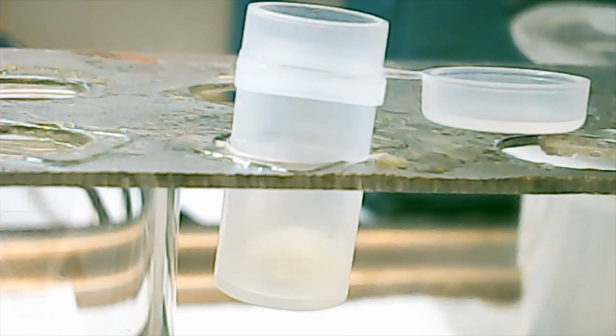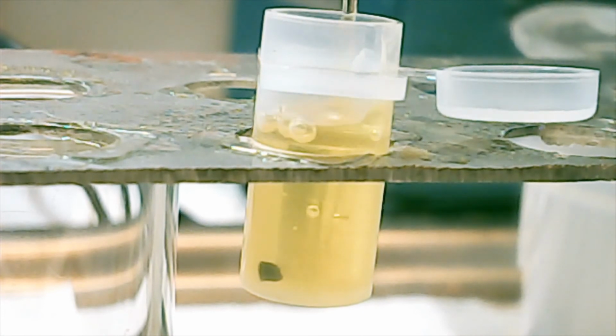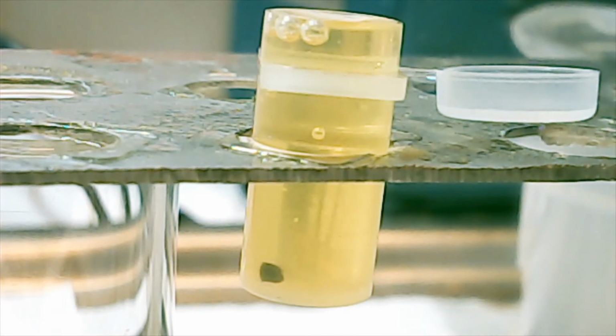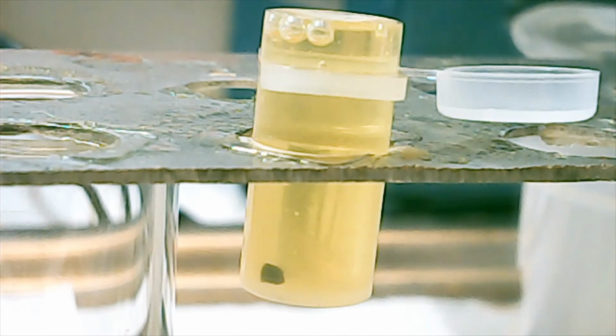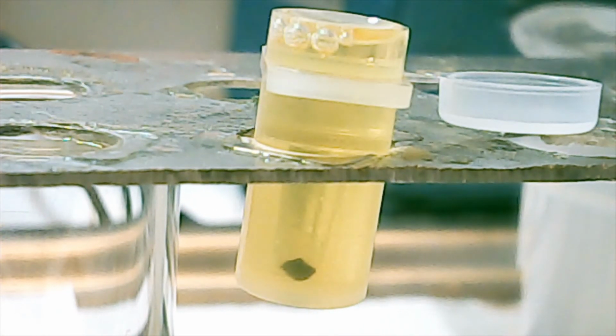So we use these plastic capsules to form the mould for our resin blocks. I'm going to transfer the tissue into the bottom of the capsule and then I will fill it with resin. And it's always good practice to adjust the specimen so that it's placed centrally. Once we've done that, the specimen is ready to be polymerized. So I'm going to leave it in the oven overnight.